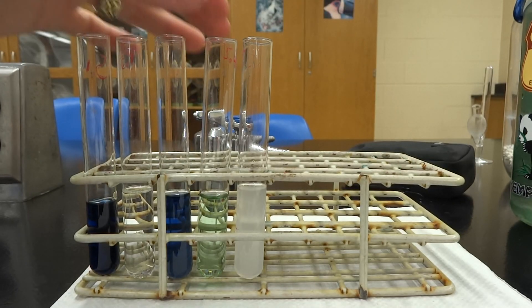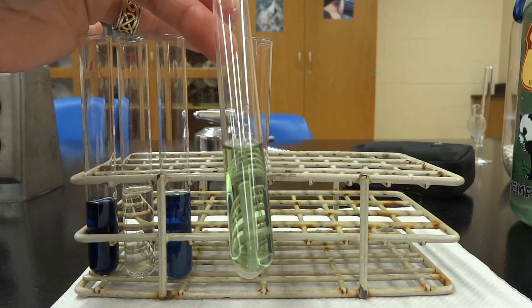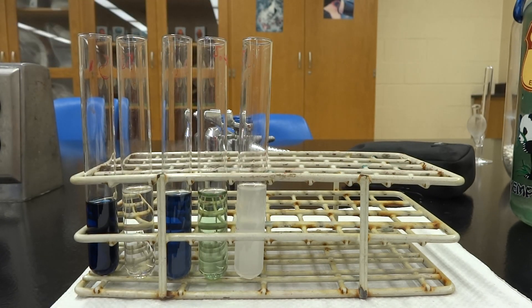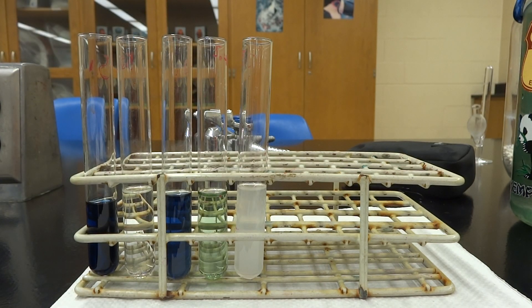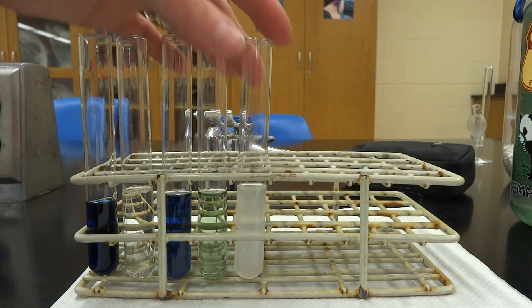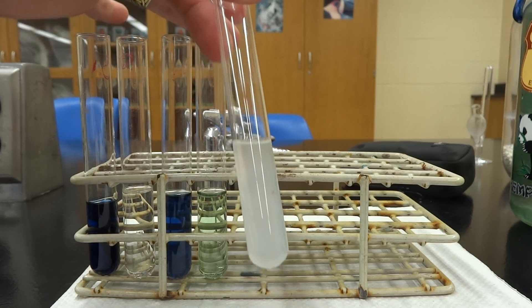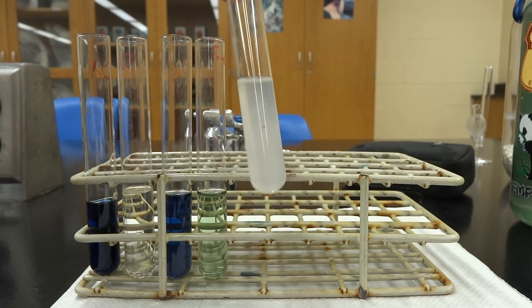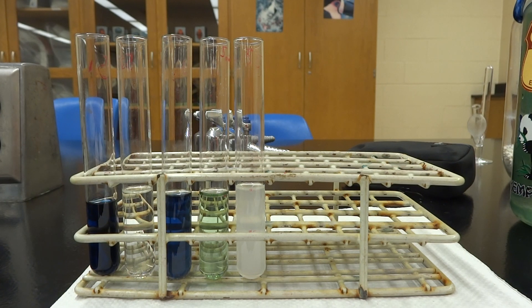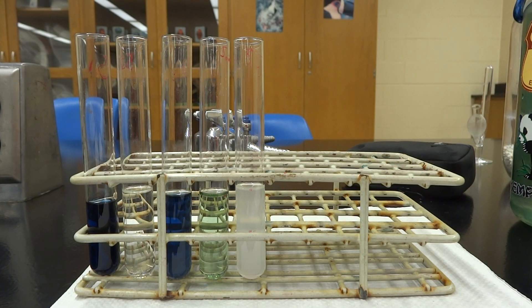Number four is sucrose again — it doesn't match our positive control or our negative, so it doesn't have DNA in it; it has sucrose in it, which is just weird. And then number five is the egg albumin. Remember, that has protein in it, so it turns kind of like egg drop soup — it's cloudy but not blue. So it does not have DNA in it.